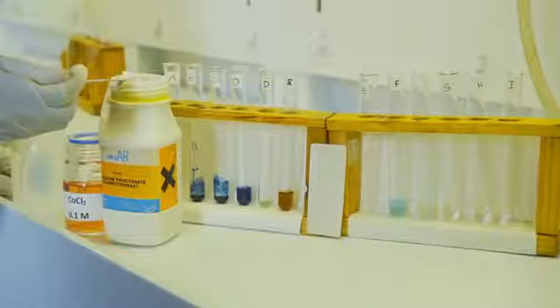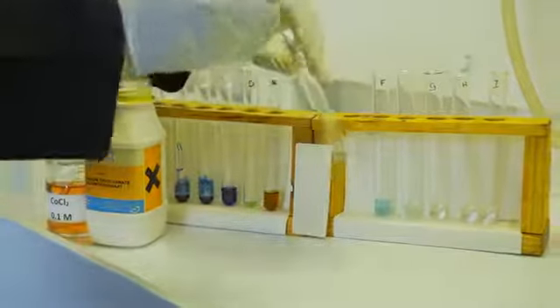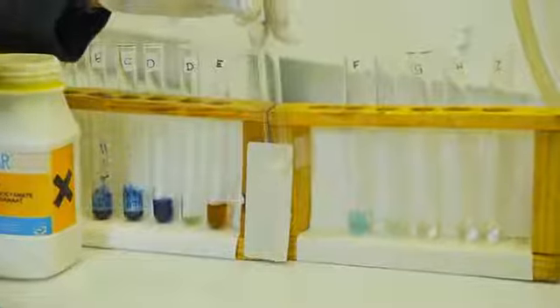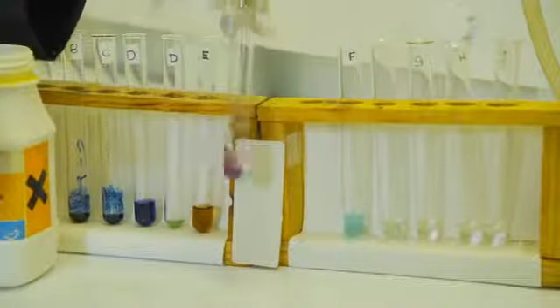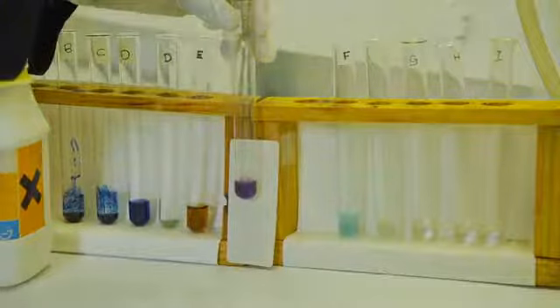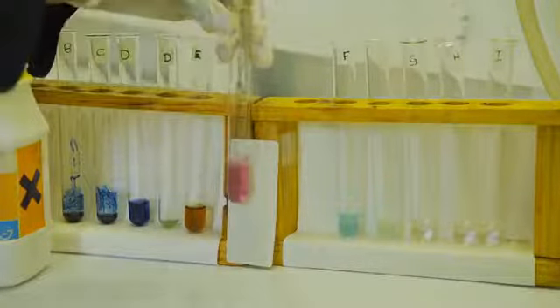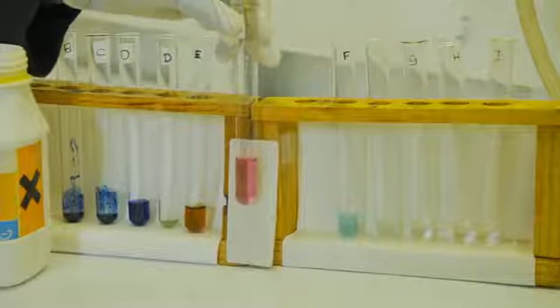In the second reaction, I will be adding a spatula tip of potassium thiocyanate into an empty test tube, followed by 1 ml of the cation solution suspected to contain cobalt 2+. This should give a purple-blue color indicating the formation of cobalt thiocyanate. Addition of 3 ml of distilled water will turn this reaction pink, confirming the formation of cobalt 2+ cations.